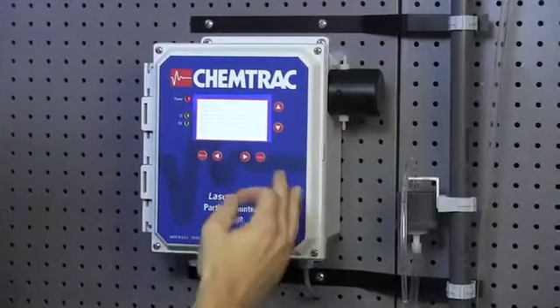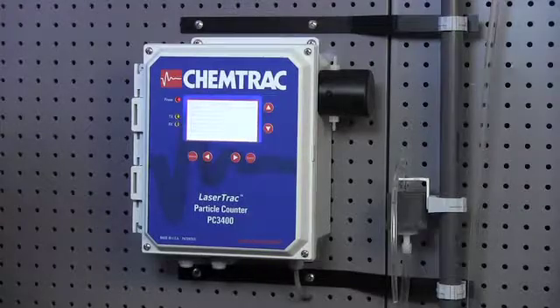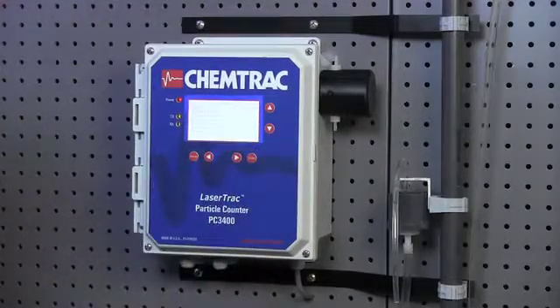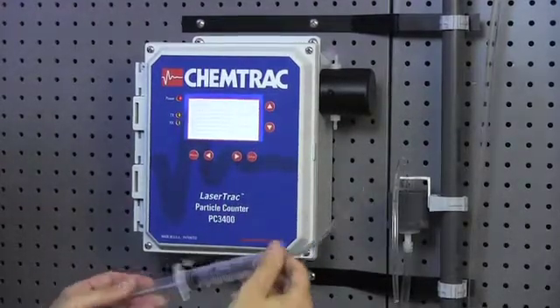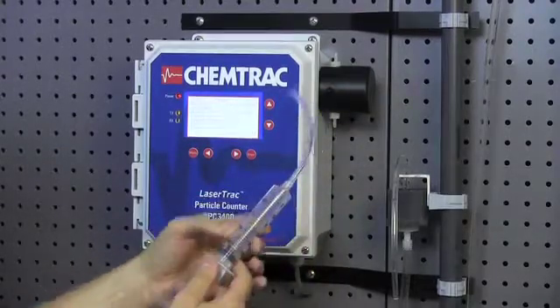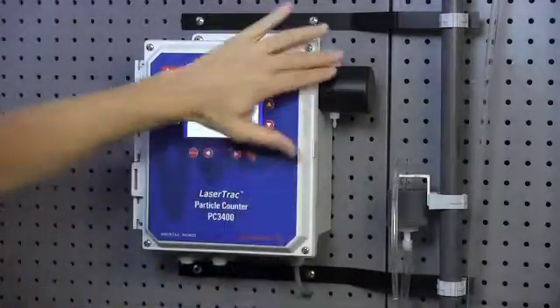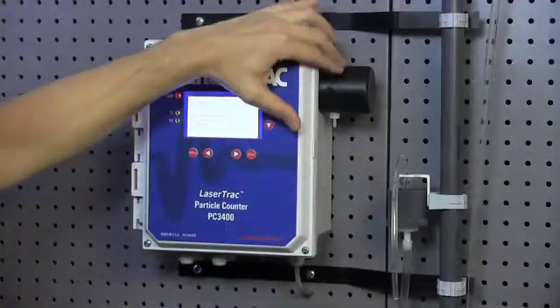If you clean the sensor and the cell condition doesn't climb up into the upper 90 percentile range, especially if it's not above 90%, you may want to consider using a syringe to do additional cleaning. The syringe can be filled with any sort of cleaner. It could be alcohol, vinegar, CLR, or other cleaners.